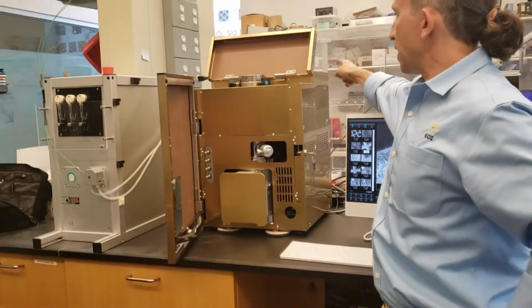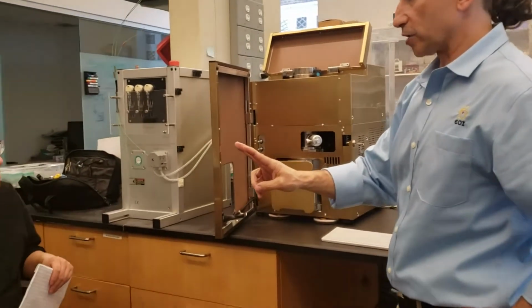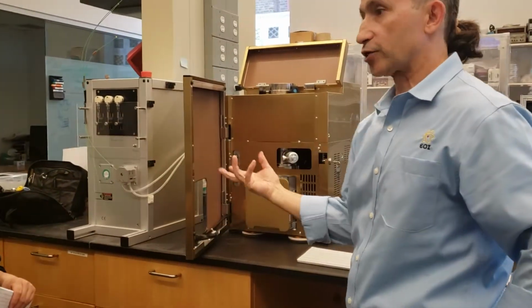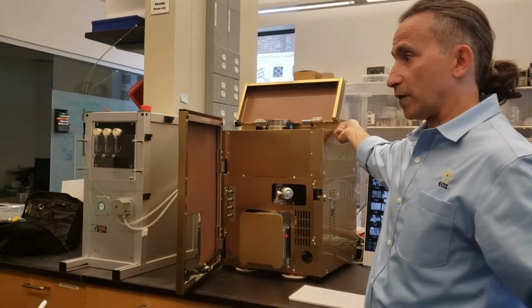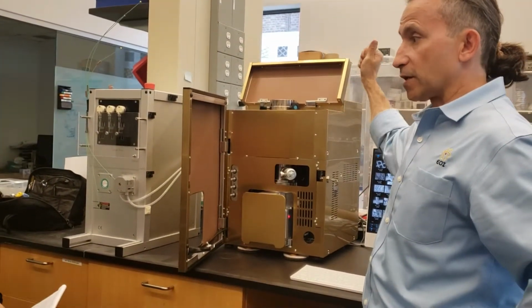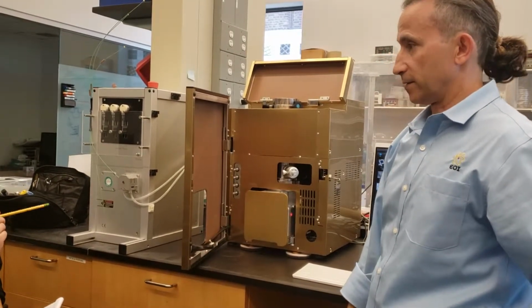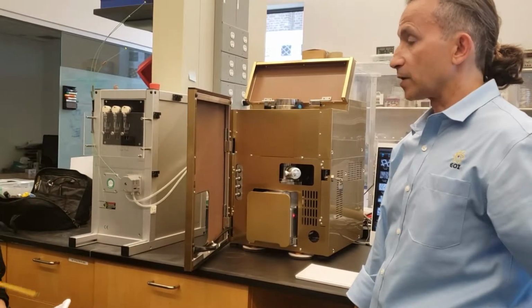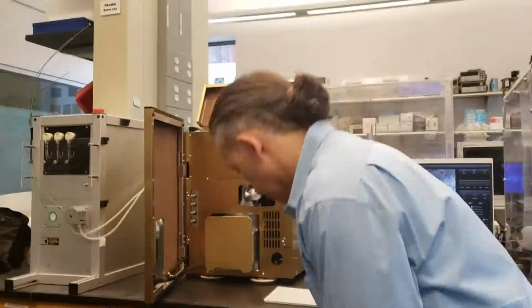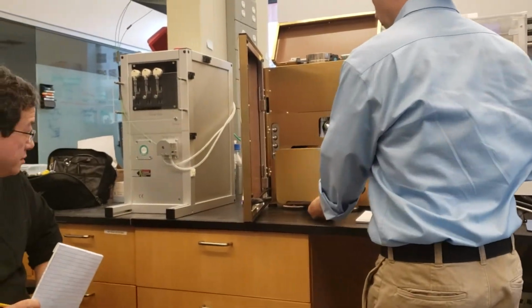So there's one toggle switch behind the microscope, and there's a power switch in the front. There's two switches. If we want to shut this off, we just push this button in, and that'll shut it off. If we want to protect it, we turn the toggle switch on the back side off. But realistically, you can leave the toggle switch on in the back, and just this button will be your on/off to the microscope. Venting. Power. Physical power going to the microscope. That's correct, the switch in the back. Yeah, because right now everything is plugged into one outlet that we have in the back side there.